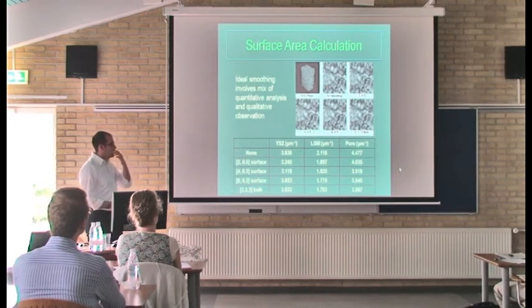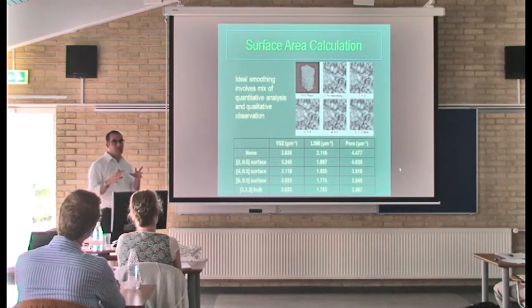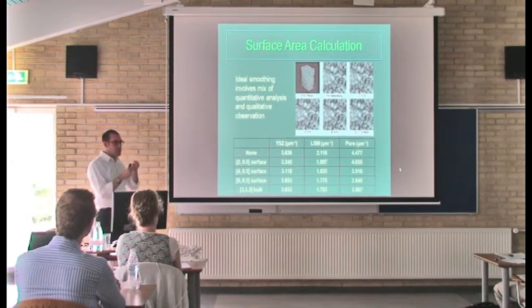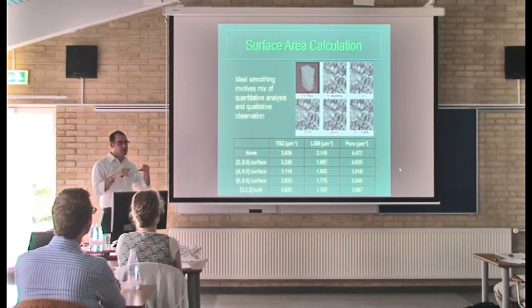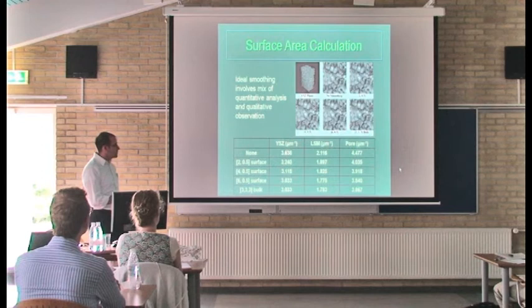So one thing that we've already seen for our surface area calculation is we take our voxelized structure and we mesh it. So we make these vertices with the polygons or triangle surface, just like Peter showed. But when you do this, you can get this kind of ripple effect depending on the shape of your voxels. It's basically called a wedding cake effect, where you have some roughness to the surface as a function of going from a voxelized structure. And so to get a surface area calculation, you need to smooth this surface a little bit. It's just a question of how do you do that and how much do you do it.